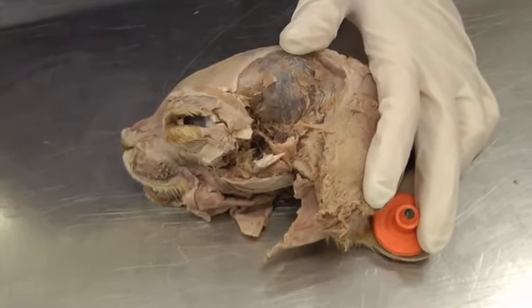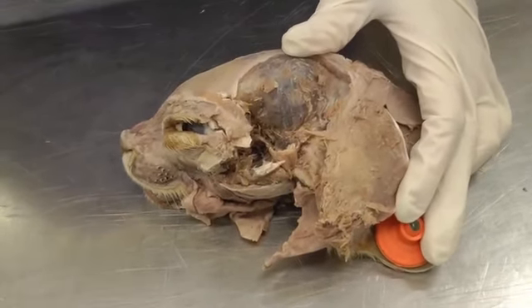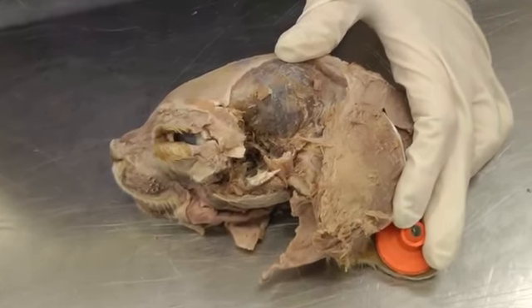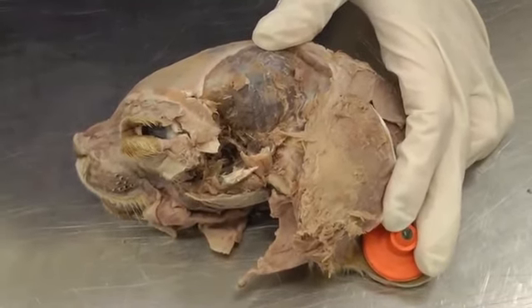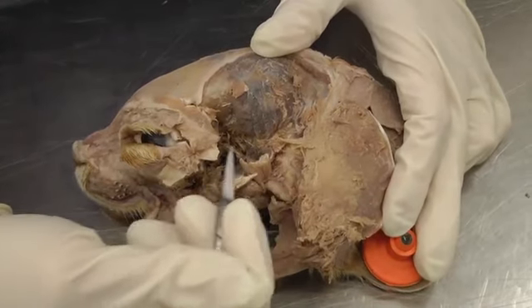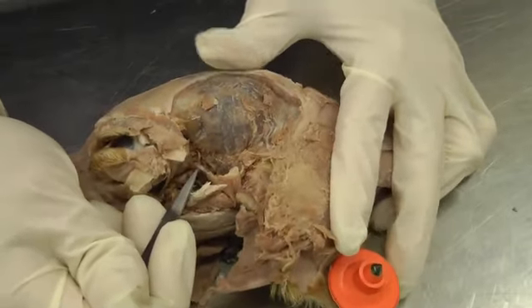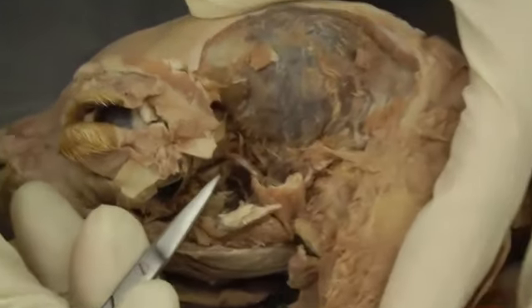This is lab 24 on the cat specimen. So again, we're doing the eye and then some superficial veins of the head. And you're working on your left half of the head, where you took out your zygomatic arch and reflected your temporalis muscle. And you're going to look for these eye structures that we're going to work on.